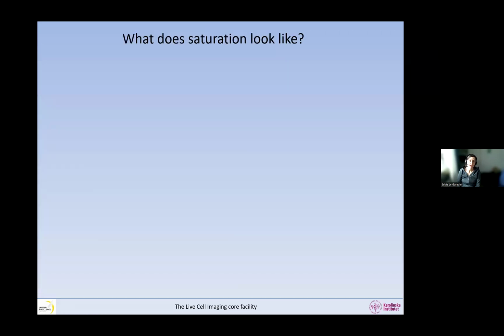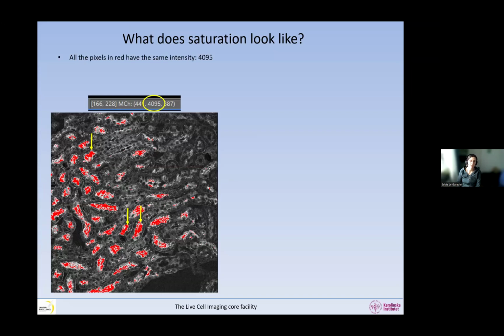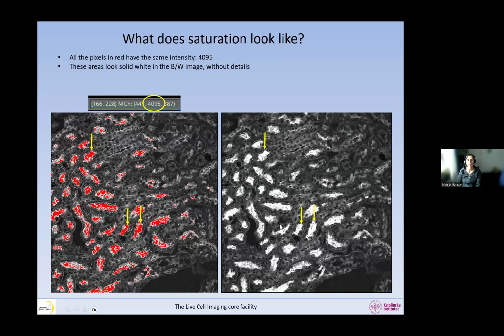So what does saturation look like? If we look closely at this image, all these pixels in red have the same intensity, 4095. In a real sample, it's very unlikely that there are so many areas with exactly the same intensity. If we remove the saturation mask, this is what the image looks like. Most of the time you look at your images this way, and this is what you should look at suspiciously. We have some areas that look solid with one color, and there are no details at all in these areas. This is an artifact of imaging, and the red pixels or solid white pixels are saturated.